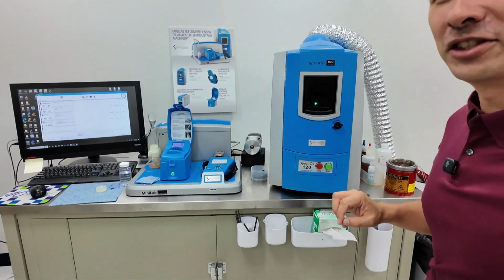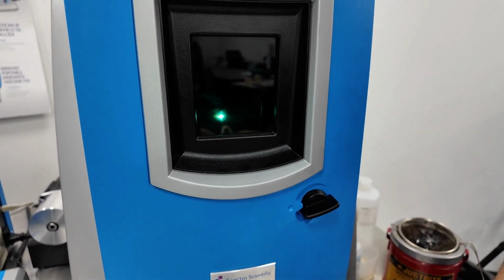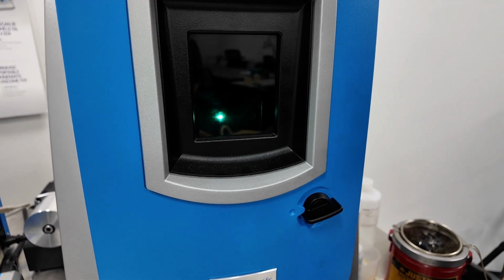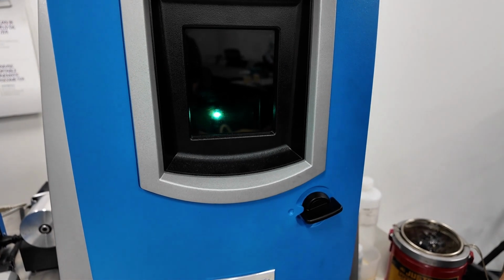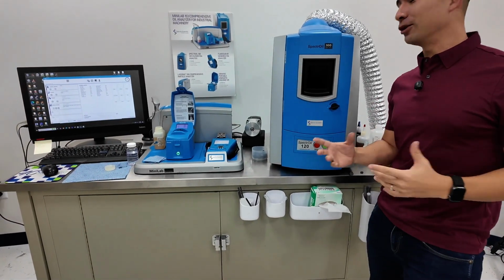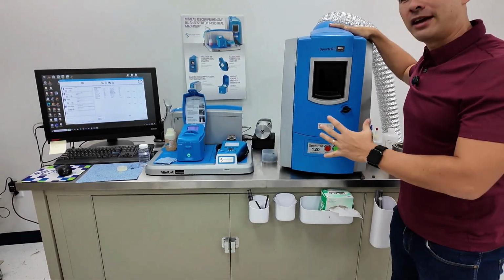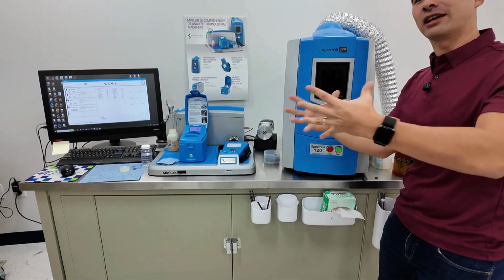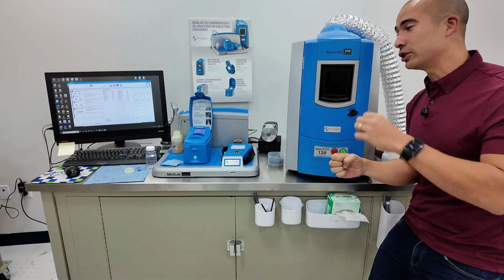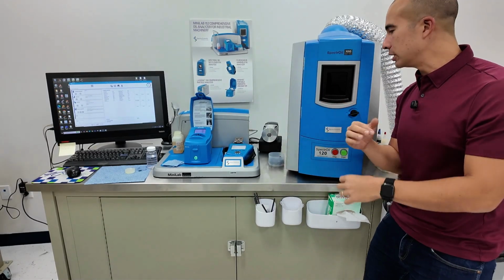I'll bring it a little bit closer. All right, so that's the exciting bit. Sparks fly, all the rest of it. Now, what's going on inside here is obviously we are exciting the sample. In basic terms, we're giving it a whole bunch of energy, and it is then going to disperse that energy. And then we use the wavelengths of light which get emitted from the sample to measure the elemental composition of the sample.